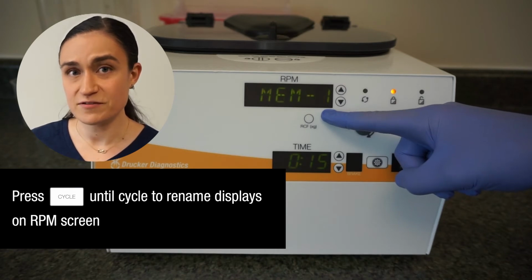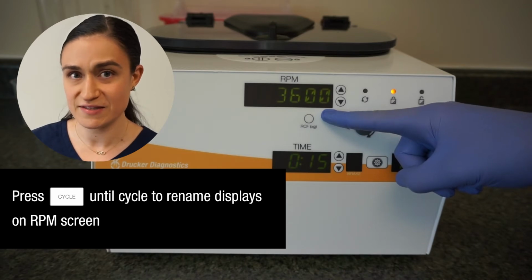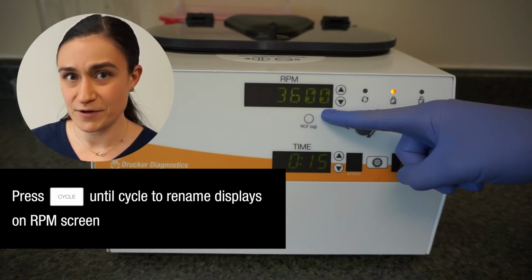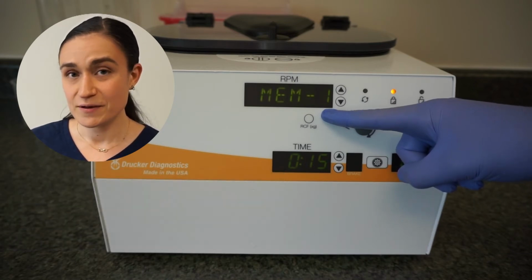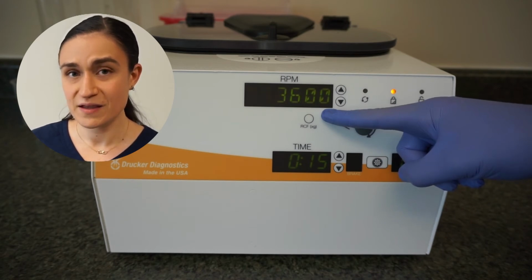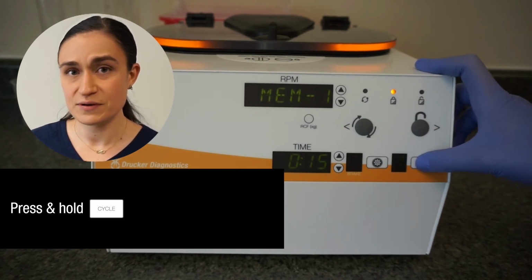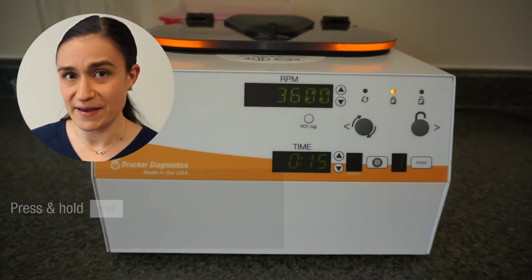Keep in mind that your centrifuge will name the new cycle MEM1, MEM2, MEM3, etc. by default. So if you're creating a new cycle and know you want to rename it, make sure to just remember or note down what number cycle, MEM1, MEM2, MEM3, it is that you just created. Once your selected cycle is showing in that RPM window, press and hold the Cycle button until you hear 2 beeps. This indicates that you've entered the Cycle menu.